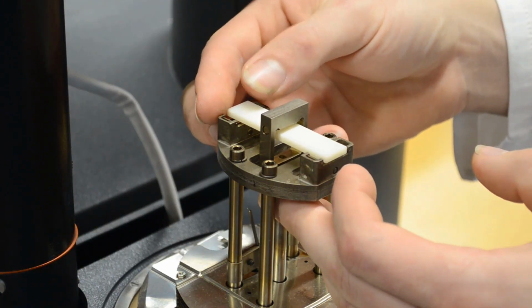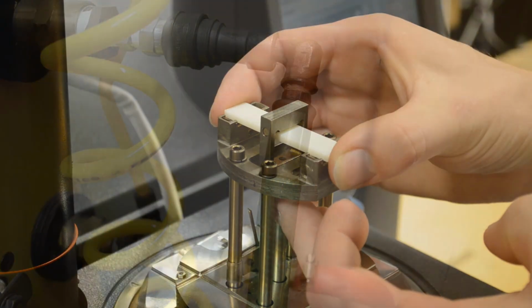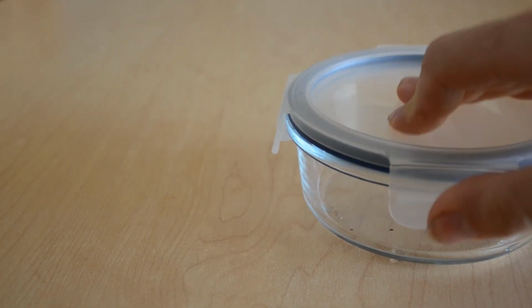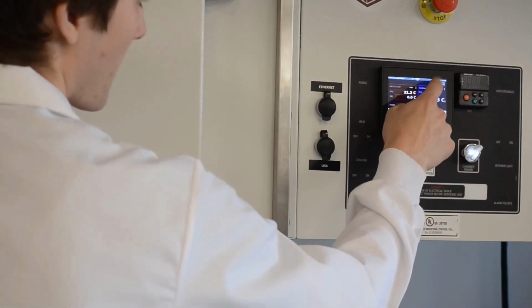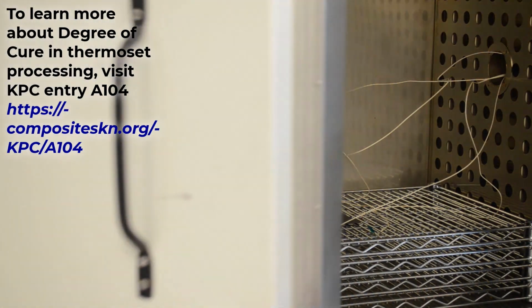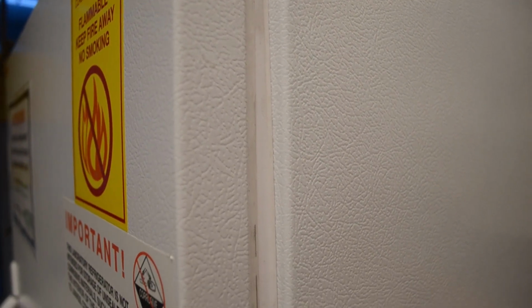A DMA can be used to characterize the properties of viscoelastic materials like plastics and rubbers over a range of temperatures. This can be useful data for component design with viscoelastic materials that are subject to stress and high or low temperatures. Creep and stress relaxation are two characteristics that DMAs can be especially useful to study. A DMA can also be used to measure the elastic properties of a thermosetting polymer while it is curing. The results can be used to design manufacturing processes involving resins and adhesives. In addition to these common uses, there are other more niche applications of a DMA. Whenever elastic properties at different temperatures or humidities are required, a DMA may be of use.